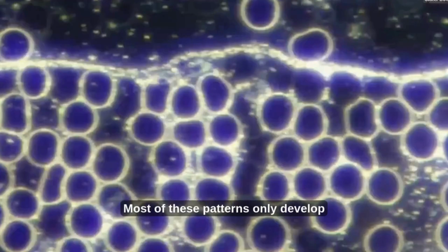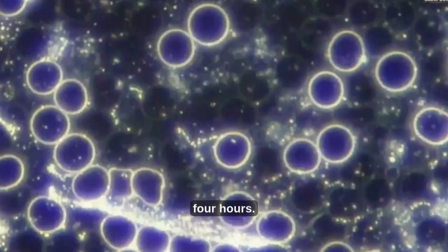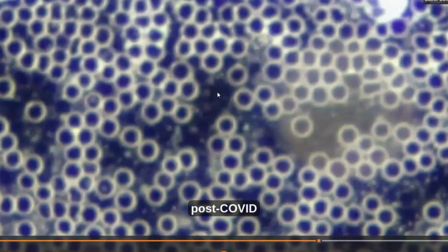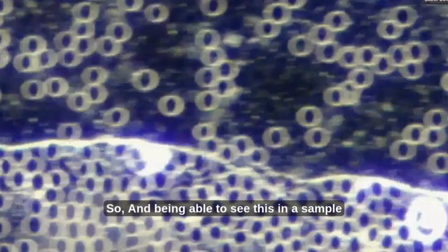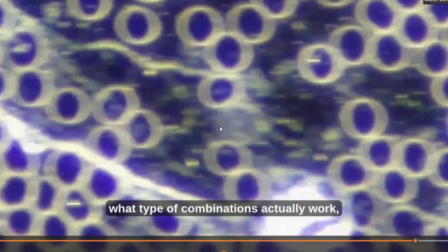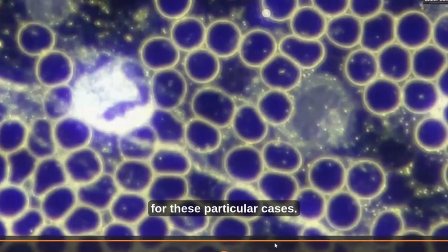Most of these patterns only develop after some time, so if the blood has been allowed to break down slowly over the course of 2 or 4 hours. So the patterns here are typically connected to post-COVID type of complications and cases, and being able to see this in a sample allows us to then track these patterns after treatment to see what type of combinations actually work, and this has been helpful in developing effective treatment strategies for these particular cases.